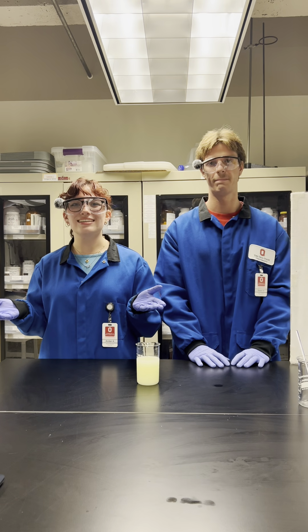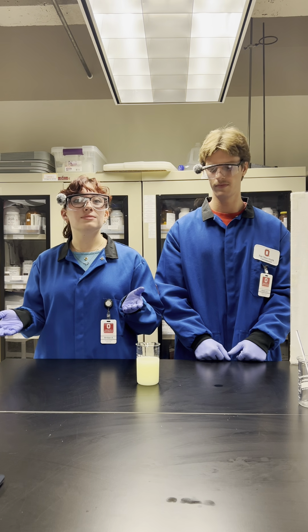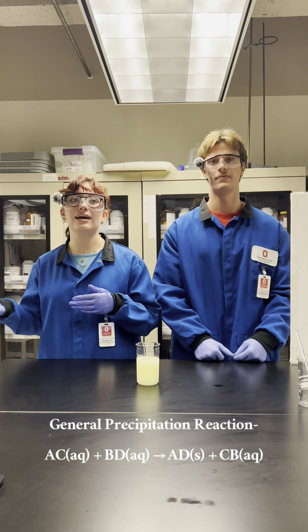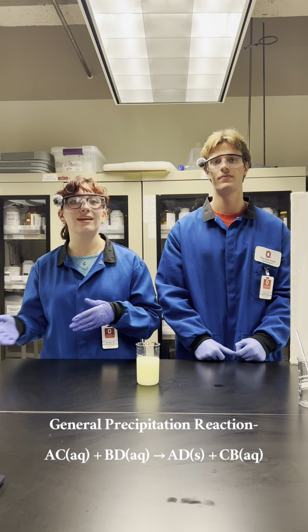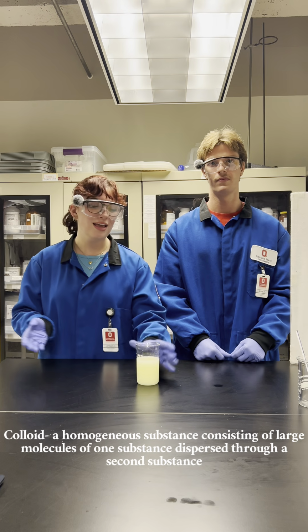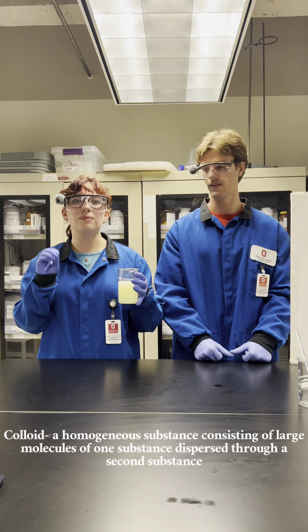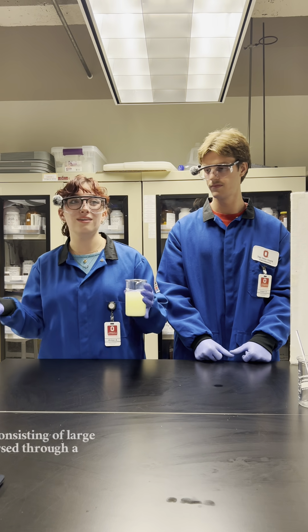Now that we've seen our reaction, let's talk about the product that we actually made. So when we mixed our two liquids, we did what was called a precipitation reaction, which is a reaction where you mix two liquids and you get a solid out of it. That formed something called a colloid, where you have one state of matter dispersed within another. In our beaker, we very obviously have a bunch of liquid, but inside of that liquid there are large particles of solid sulfur, which makes it a colloid.